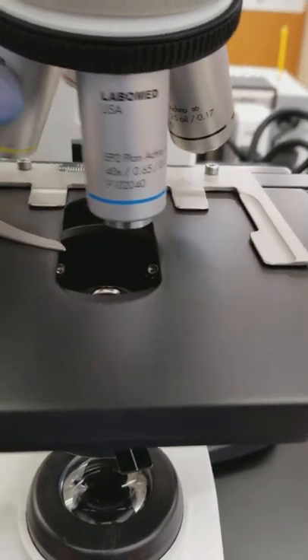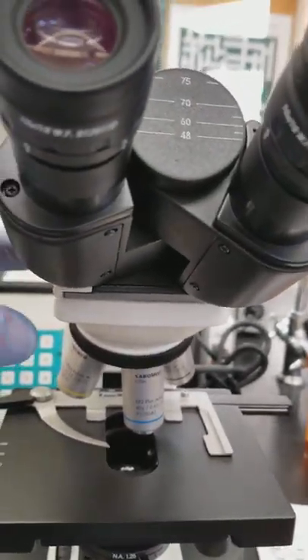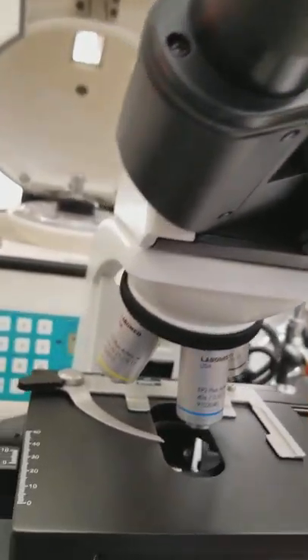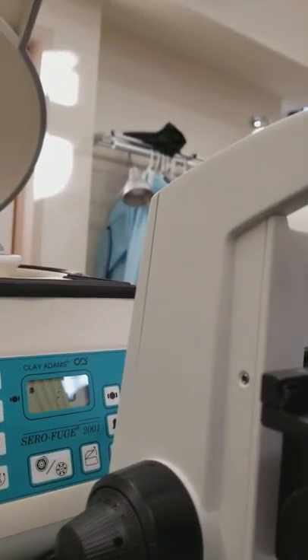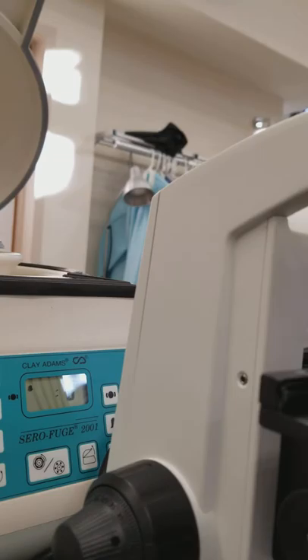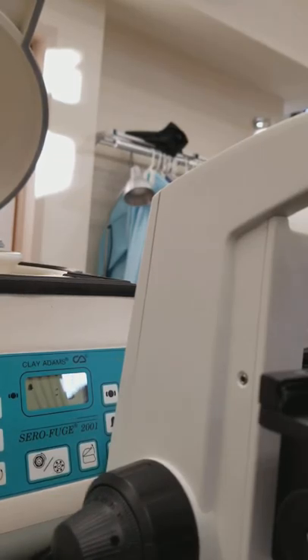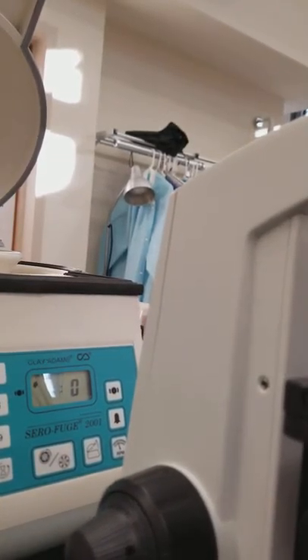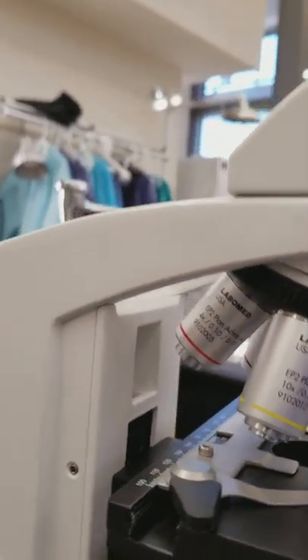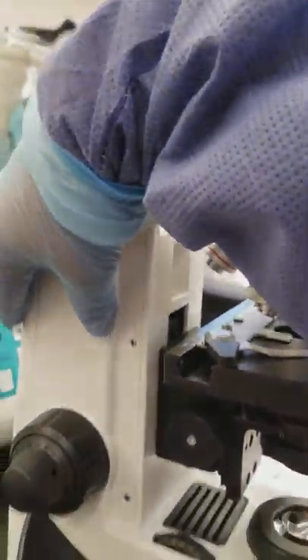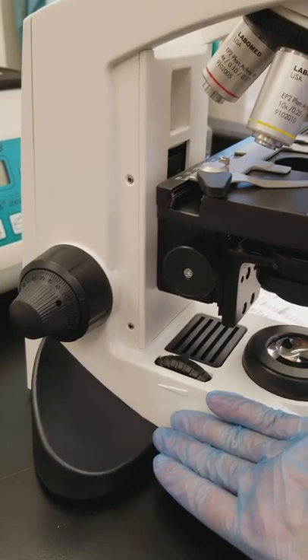We used to have a head that swiveled on the microscope but we don't now. So what we want to do is unplug it from the back, and when we go to pick it up we're going to hold the arm and the base of the microscope.